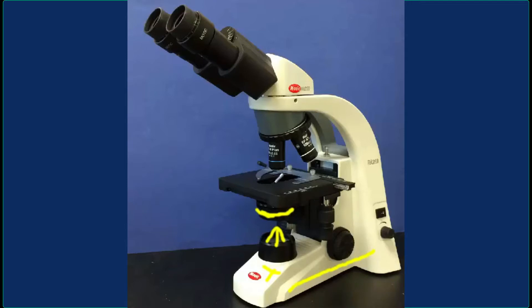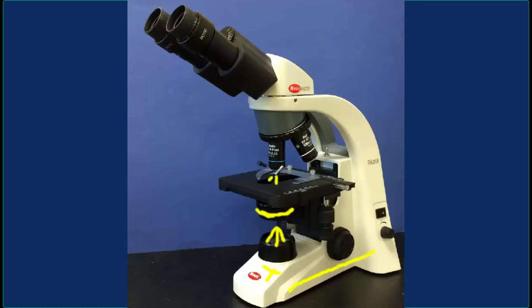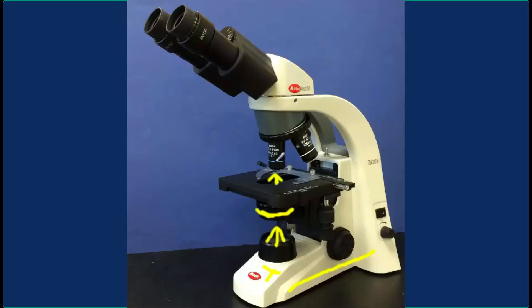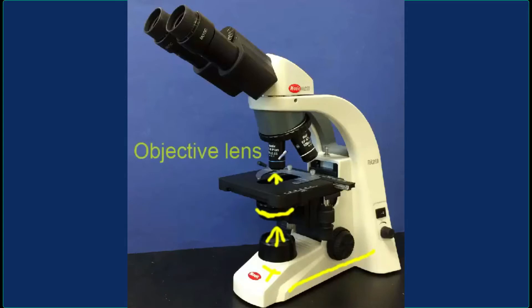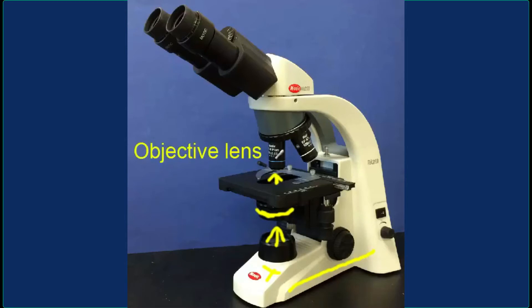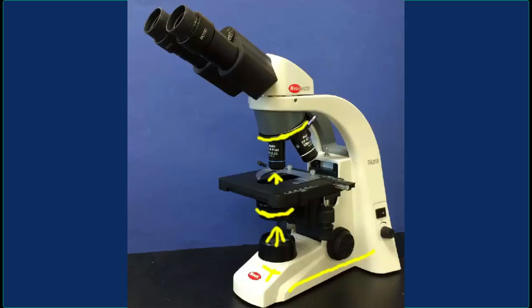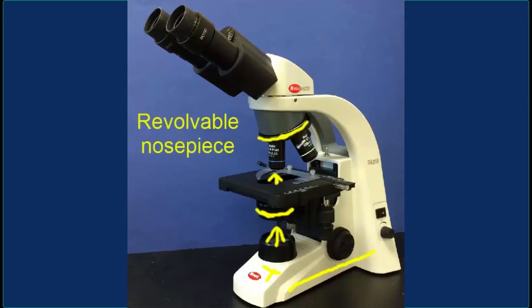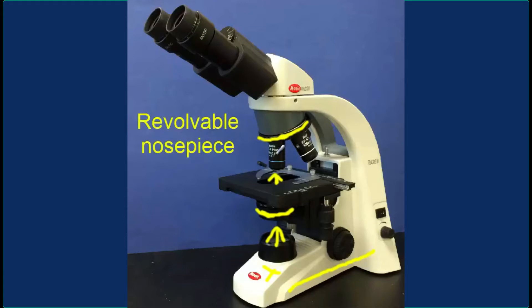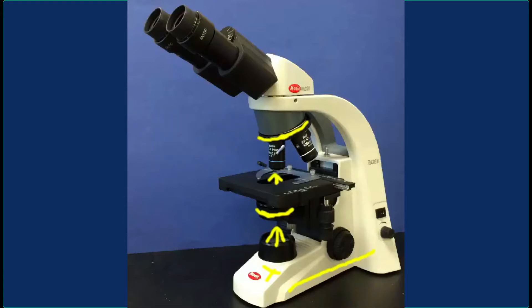The lighting is going to go through the opening in the mechanical stage, through the microscope slide, and then enter one of the objective lenses. You can see there are four objective lenses on this revolvable nosepiece. We'll go through each one of these objectives and talk about what kind of magnification you're going to get with each of them.